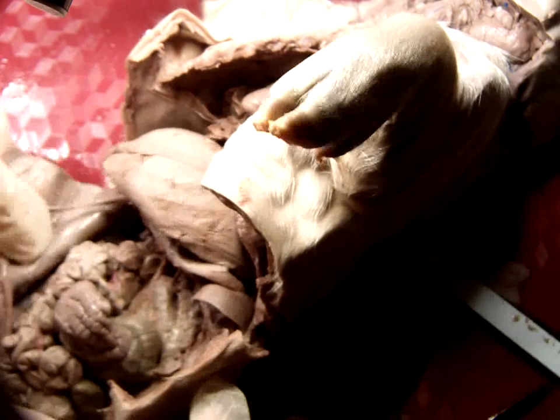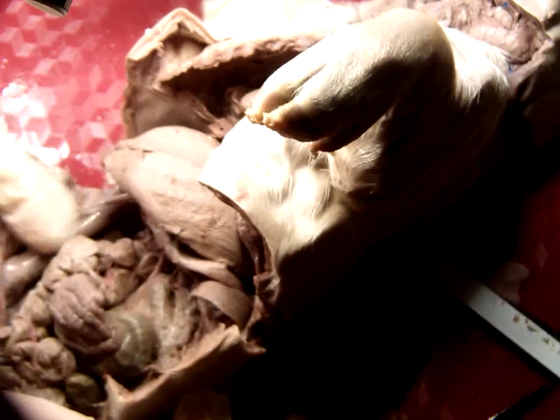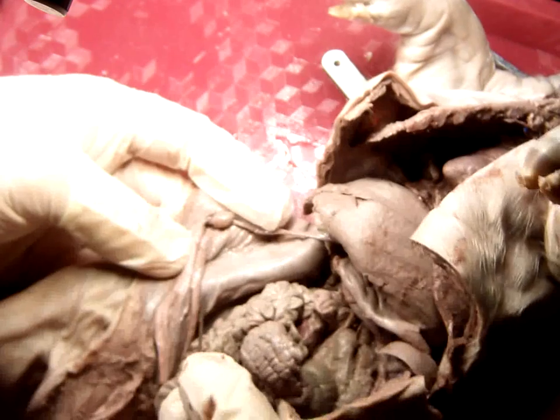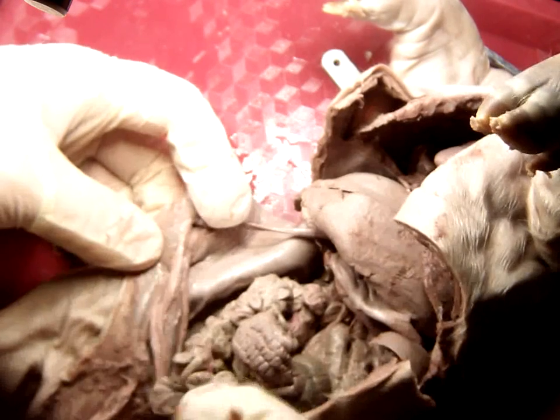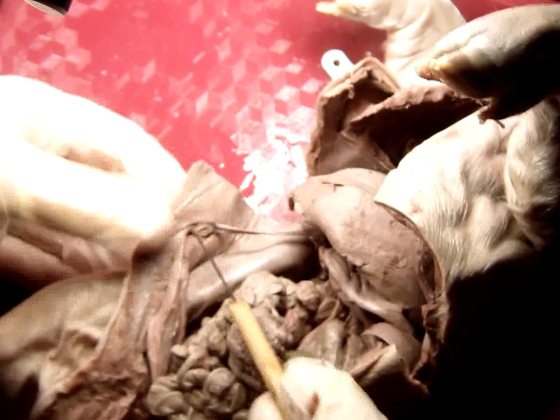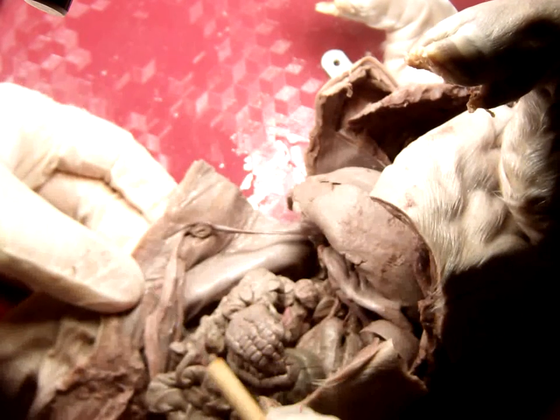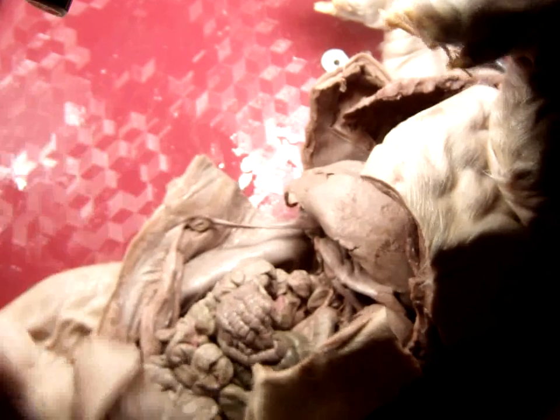But in between the 2, this is so weird, folks. Right in between the 2 here, that's the urinary bladder. Oh, you can't see what I'm pointing to. My bad. Okay. So here's those blood vessels, here and here. And in between the 2, long and skinny, is the urinary bladder. After development, once the umbilical cord heals into the umbilicus, these blood vessels will disappear, and this bladder will settle back down into the lower abdomen here.